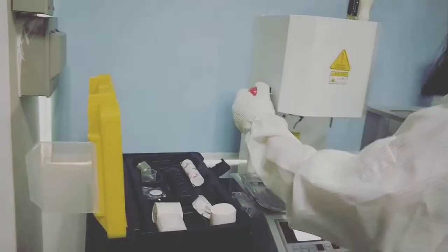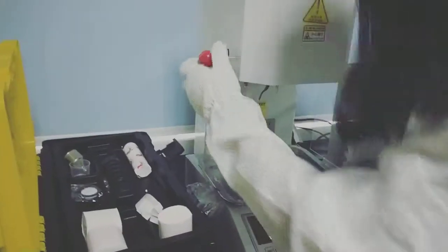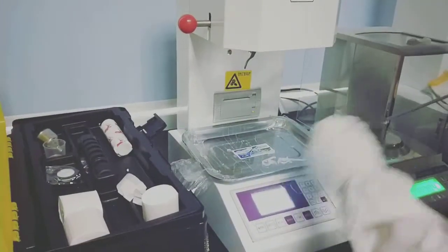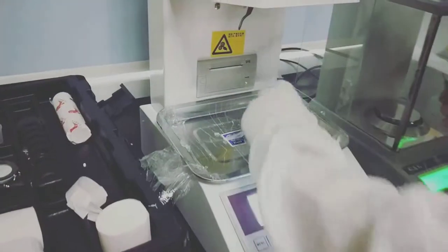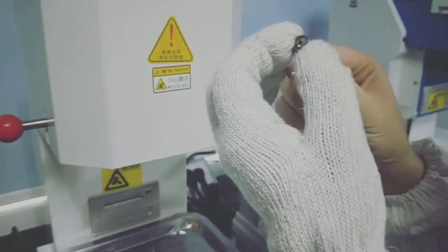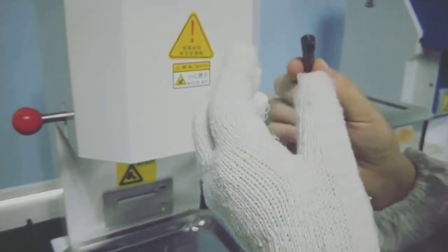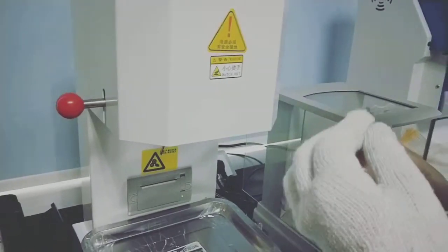Press this button, take off the die. Use the cleaning rod to clean the die. This is very important. I need to clean fast when the die is hot.